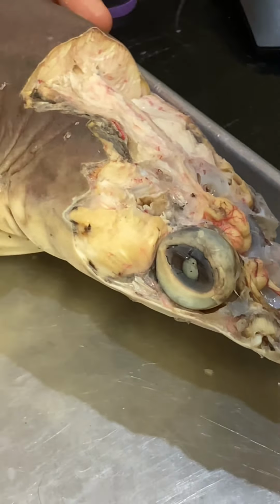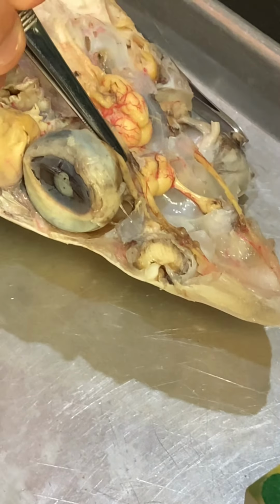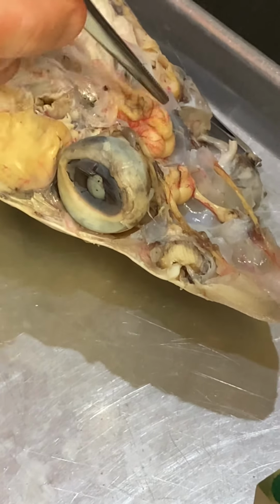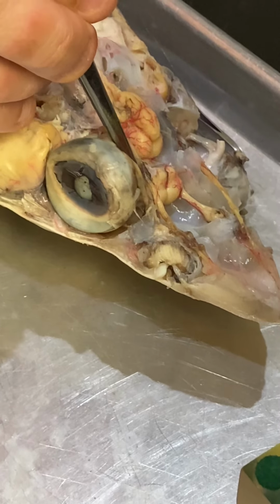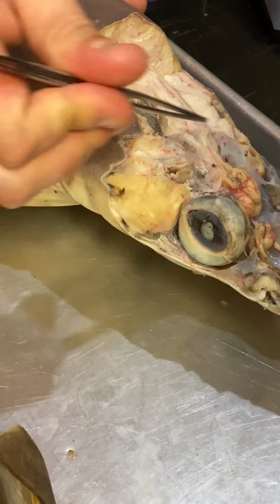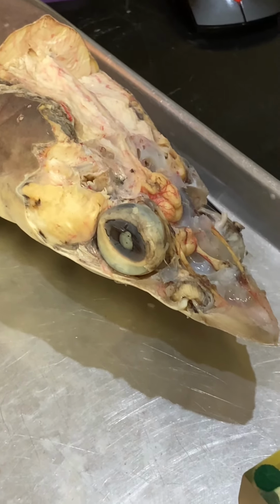Stuff like the trochlear nerve. So this is actually the trochlear nerve here. I'm not going to stick a pin through that and ask you to identify it. But what you can do is go through the manual and learn where they are. You can see that this is running to the dorsal oblique, so that tells you that the trochlear innervates the dorsal oblique. So in terms of what I could have pinned and labeled, it'll be these larger major structures.